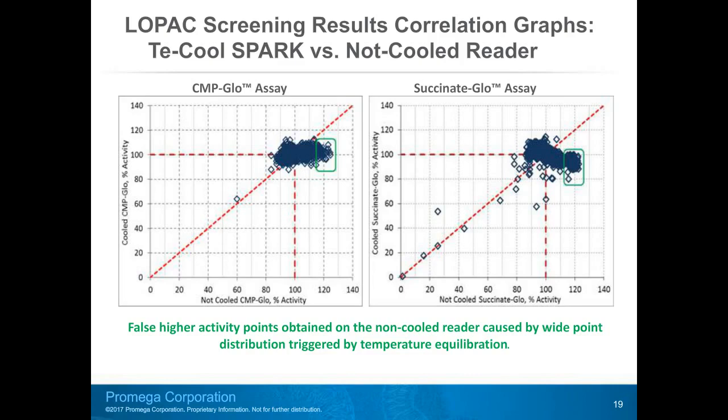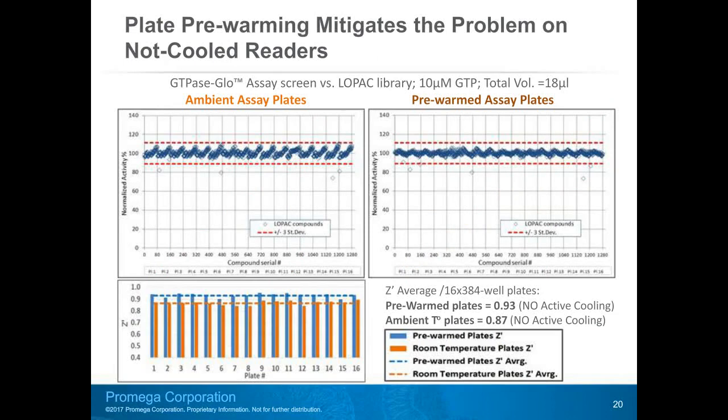On this slide, I show correlation graphs of the data obtained on cooled versus not cooled reader for 2 assays. For both assays, green rectangles mark higher activity points obtained on the not cooled reader caused by the temperature equilibration effect. The greater spread of the data obtained on the not cooled reader significantly impacts the ability to distinguish the real hits. Now, the adverse effects of reaction volume heating on signal variability can be successfully mitigated by pre-warming plates before taking the measurements. Pre-warming can be done inside the reader, especially if just one or a couple of plates are being measured. But pre-warming can also be performed inside a dedicated incubator set to a temperature matching the reader's internal operating temperature.